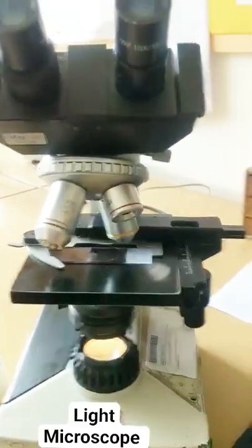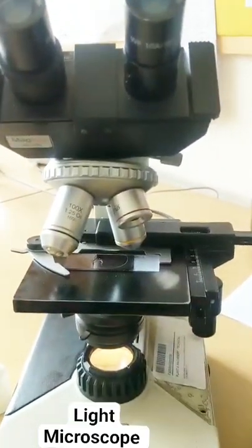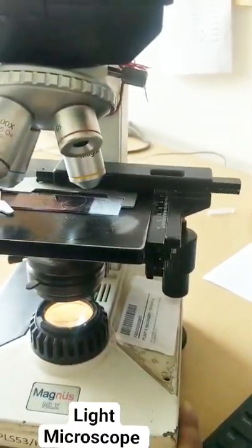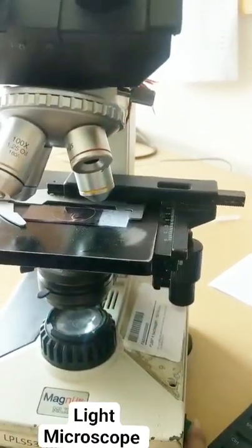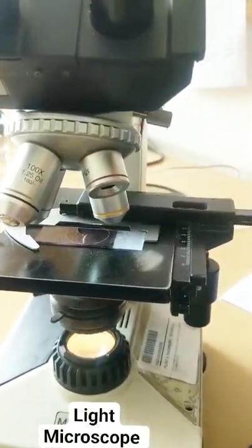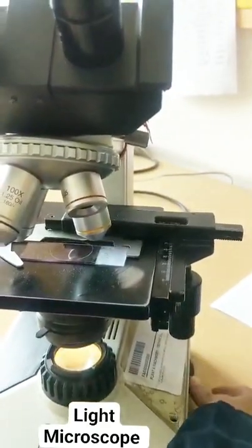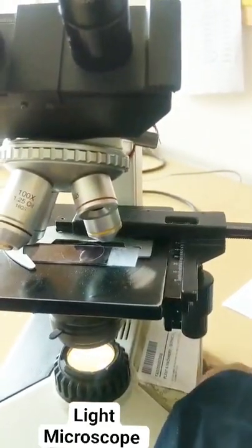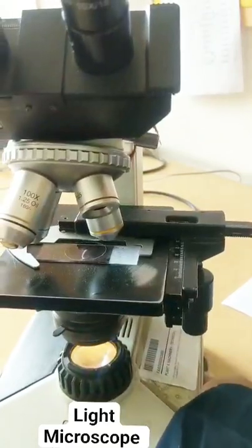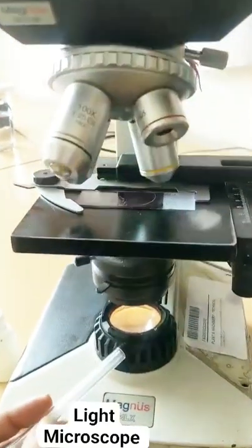Do you notice that at the bottom there is a light source present over here? This is the knob with which I can switch the light on and off. There's also a regulator over here — I can adjust the amount of light that I would be needing. So number one, I have a light source.